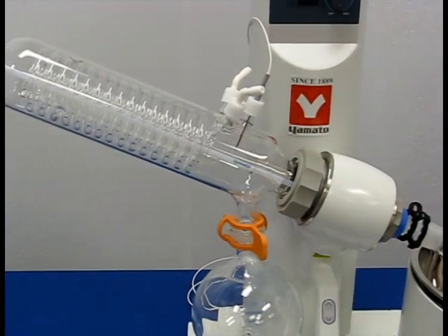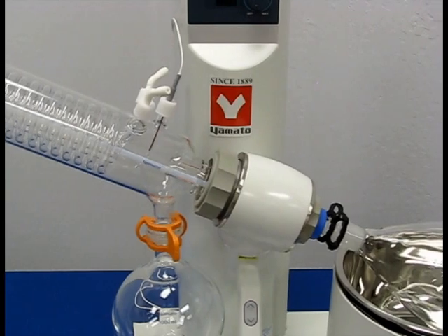At this point, take the time to check and make sure that all glassware pieces have been securely connected.